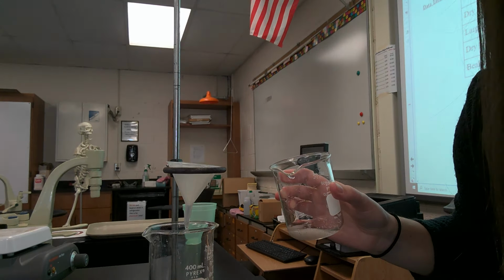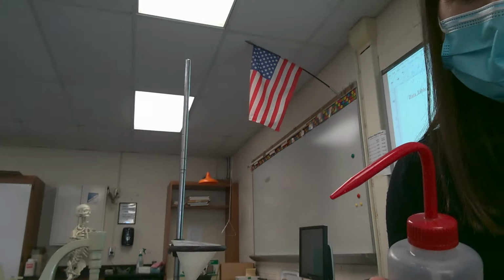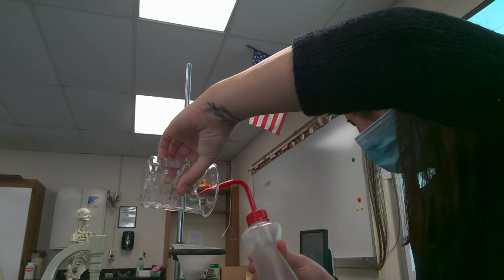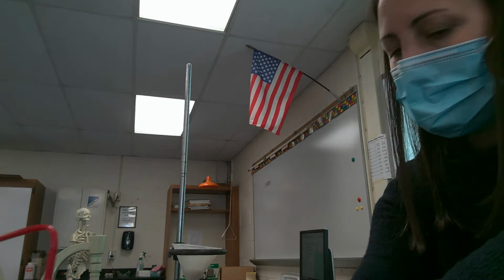Okay. So I'm going to go get a squirt bottle while I'm waiting for this, and I will be right back. Okay, guys, so I have my squirt bottle of distilled water. You could see the funnel there, and I'm just going to make sure I get all the sand into my filter paper. Now, the filter paper is going to be wet, and we don't want to weigh it wet. So what I'm going to do after this filters is take my filter paper and my sand and put it in the oven and dry it.